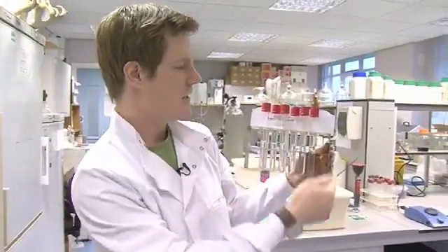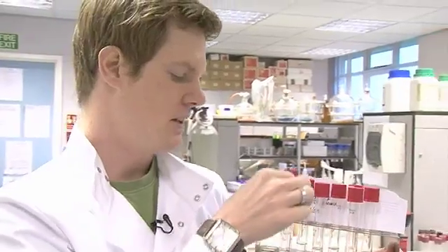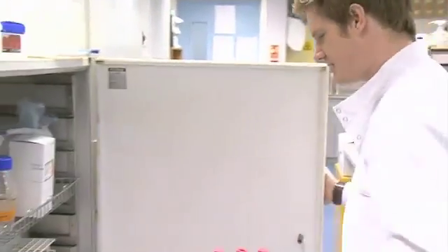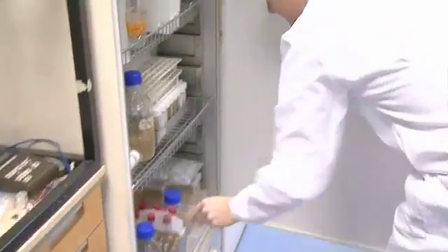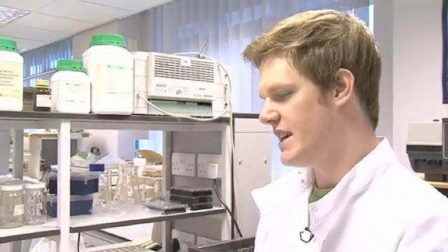In here we've got nine different samples from nine different sites, so they'll have different amounts of nitrogen and phosphorus in them. Once I've taken out my digest and got them all in the fridge — because they need to be stored at low temperature — I start looking at ways to test how much nitrogen and phosphorus is in each sample.